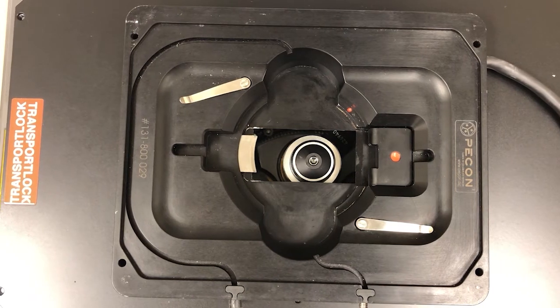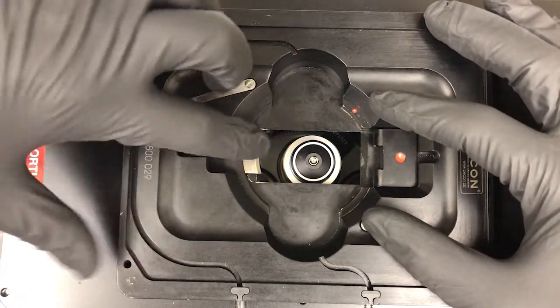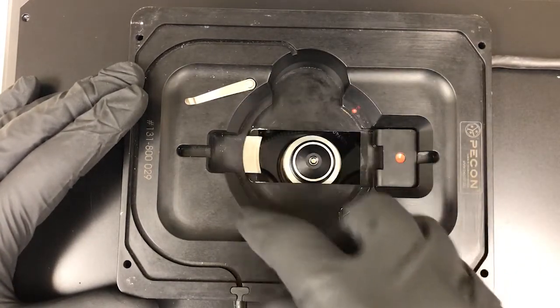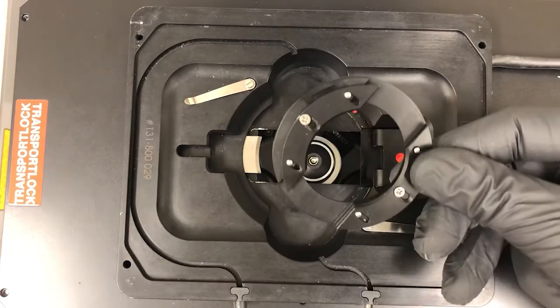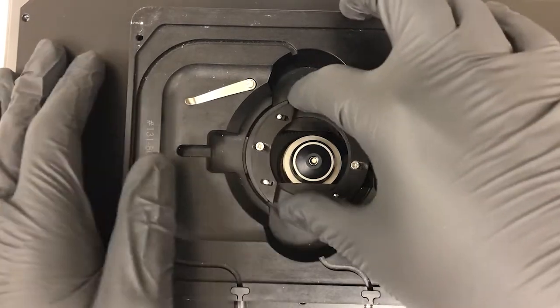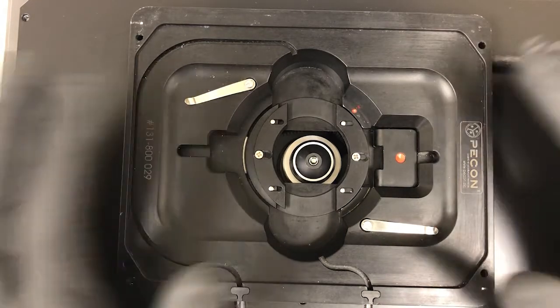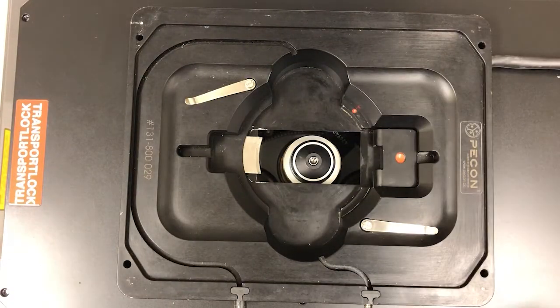We can use the joystick to center the position that we want. Notice how this has a spring-loaded holder here, a size adapter here, and a circular region for bigger dishes. Now, if you're using 35 millimeter dishes, you need to grab the following component, which is always around, and then place this adapter ring here. So you can see I've placed it there. This will hold a 35 millimeter dish. You can even tighten it if you want. If you're okay with the dish being held loosely, and that's usually not a problem, you can just leave it like this. So if you're using a 35 millimeter dish, you would use this. If you were using a bigger dish, you could just use this space.